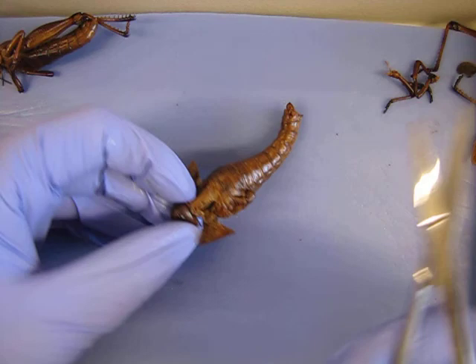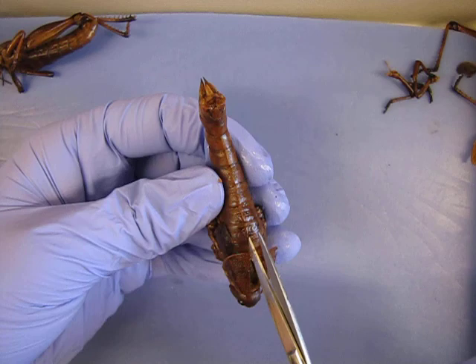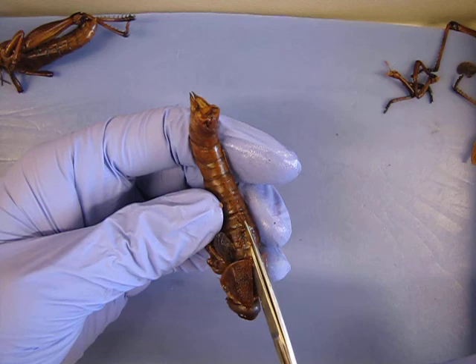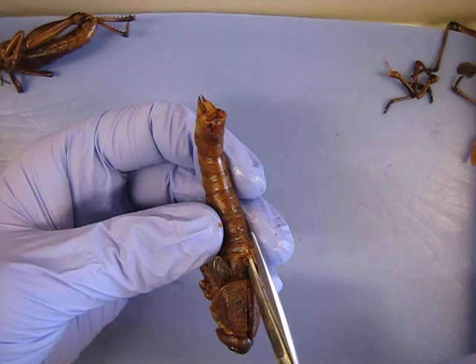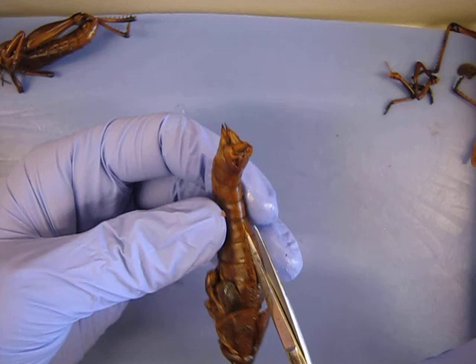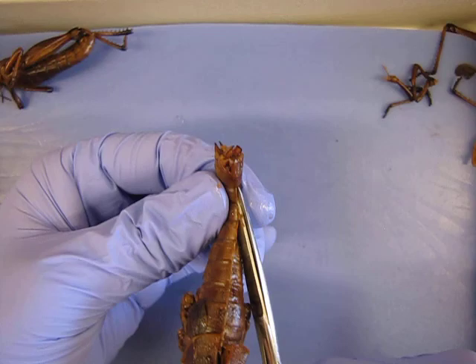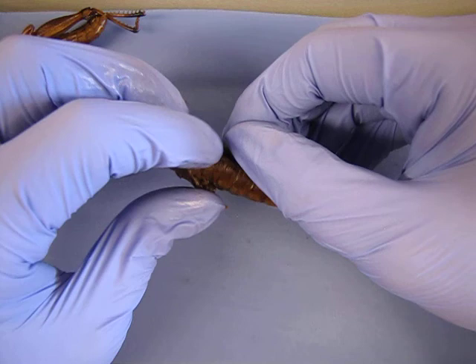I'm going to very carefully cut along this edge. I'm not using my scalpel for that because it's harder to control cutting deeper with the scalpel. Whereas with the dissecting scissors, you can put the lower cutting surface just under and then pull up a little. I'm going to push this in there and pull up — that hopefully means I just barely get the exoskeleton and not a lot of the underlying structures, which will leave more things intact. I'm going to cut that all the way down and then very carefully start retracting this.